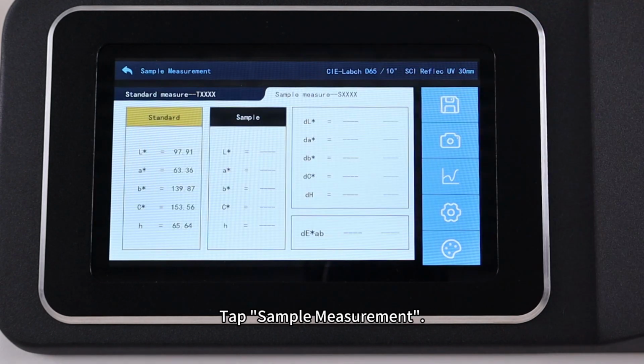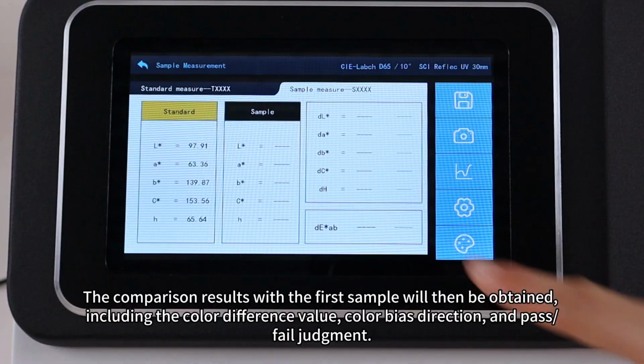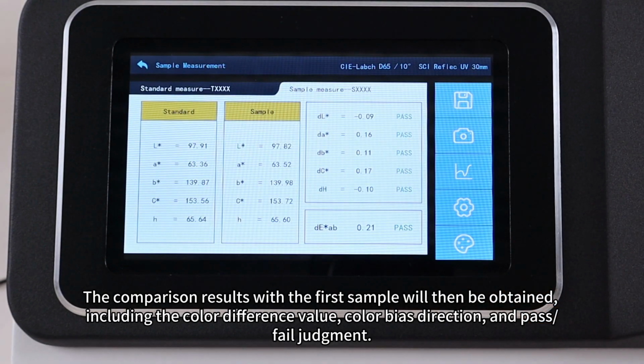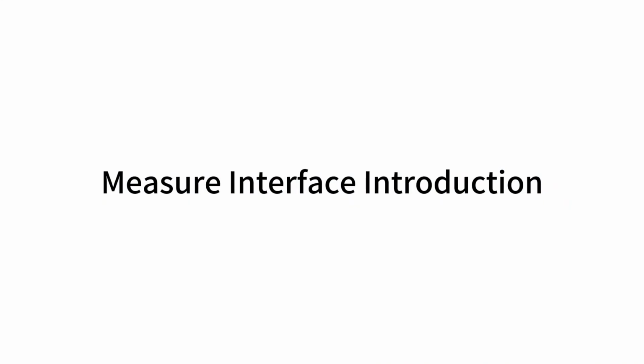Tap Sample Measurement. Place the second sample on the test port and take the measurement. The comparison results with the first sample will then be obtained, including the color difference value, color bias direction, and pass/fail judgment.